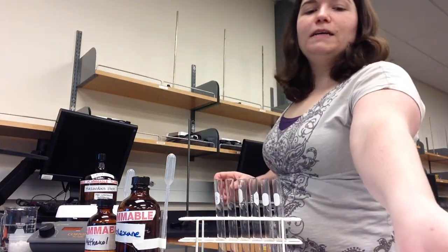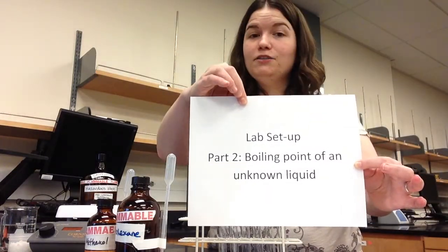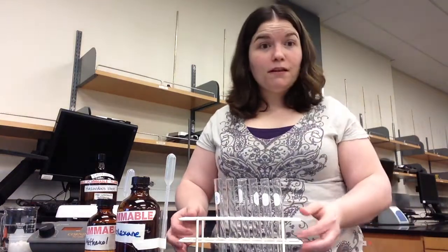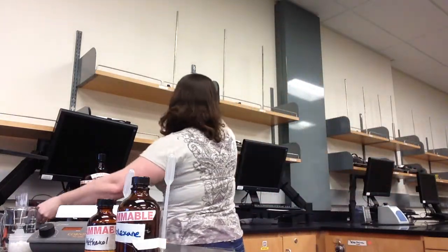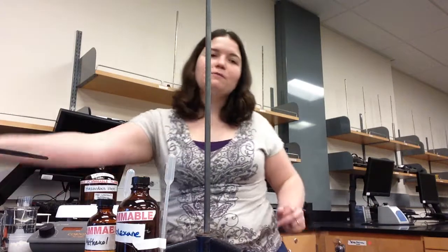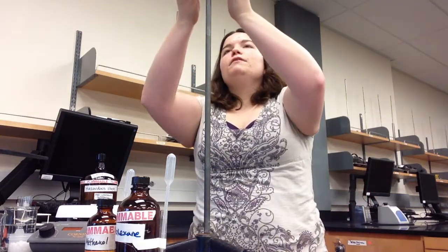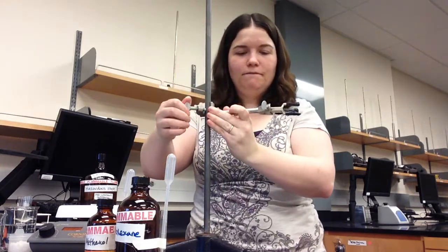The next part of this lab is the setup of the boiling point of your unknown liquid. You will not need to determine the boiling point of your unknown solid because solids do not boil. For this part of the experiment, you will need a ring stand. Ring stands are found on the side of the lab room, on the shelves, and they are used to hold clamps which hold our glassware above the lab bench. You can find test tube clamps, like this one, in the drawers on the side of your lab bench. Make sure you put them back there at the end of the lab. You can load the clamp by putting it on the top of the ring stand and tightening it down.